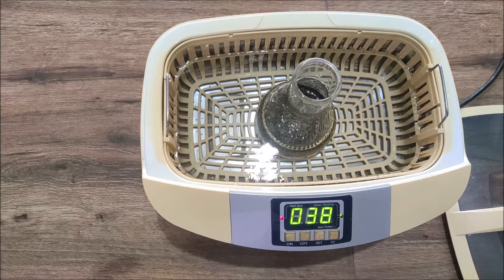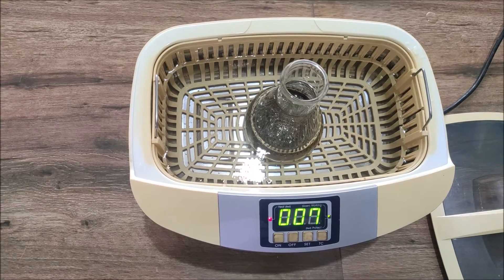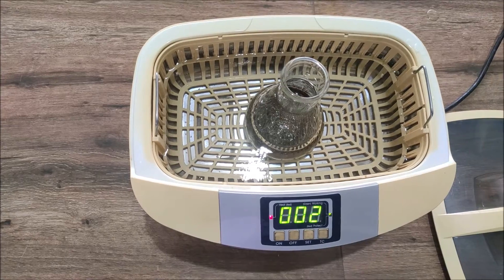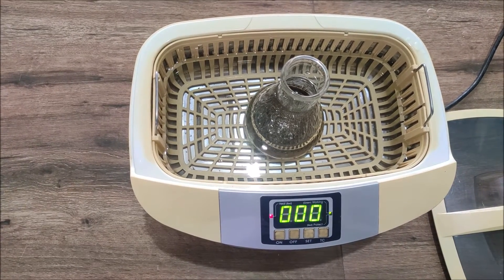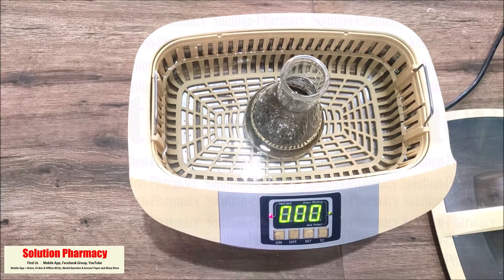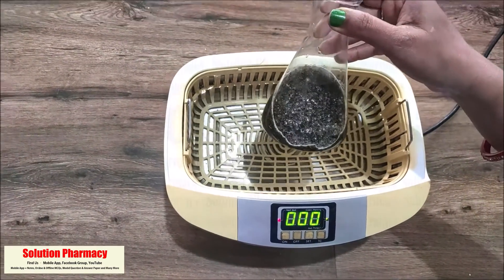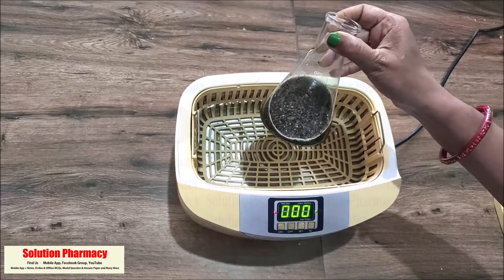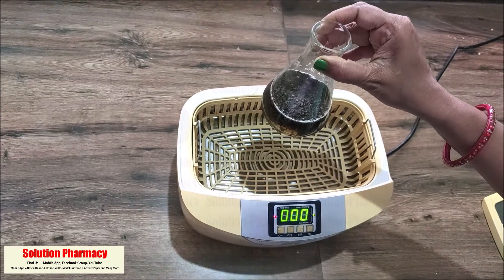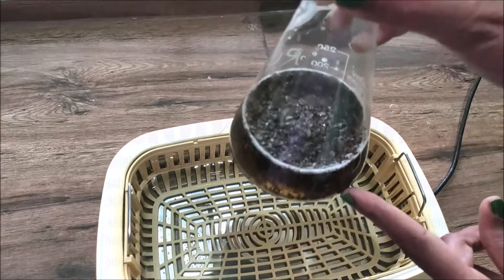Here you can see the reading on the display indicating the time countdown. When the set operation time is completed, the display will show zero and the sonication process will automatically stop. Here you can see that the time set for the extraction is completed, the display is showing zero, and the sonication has automatically stopped. Now you can remove the flask from the bath. In a very small time, the chemicals present inside the plant material have been extracted and separated out into the solvent.